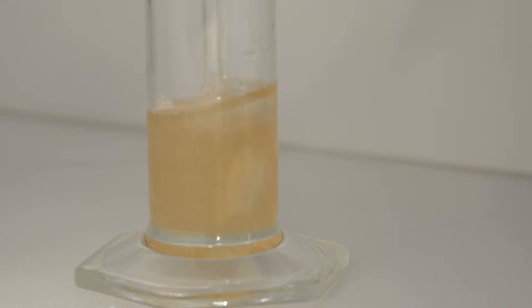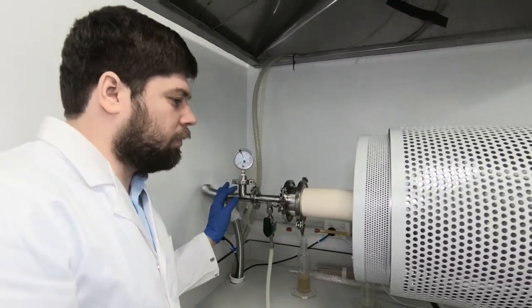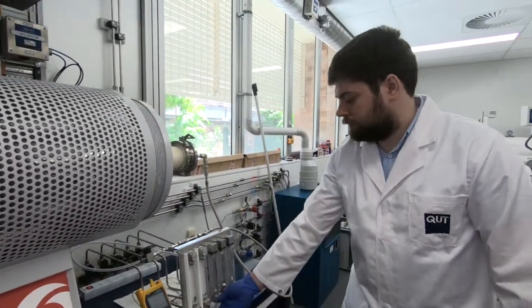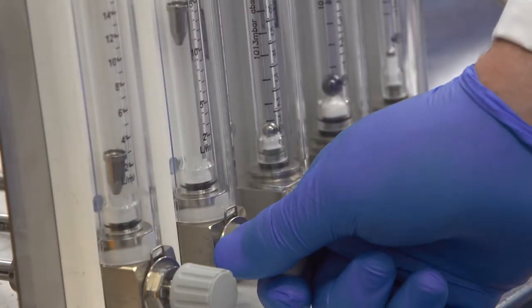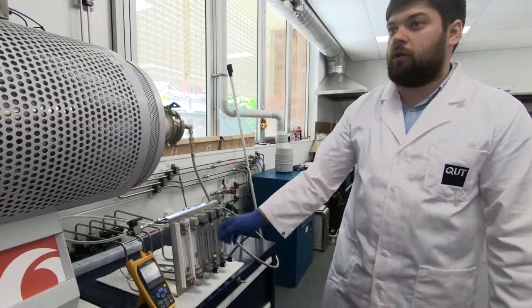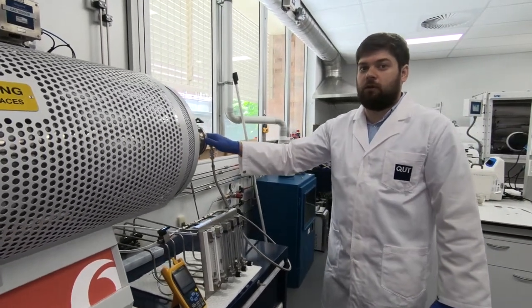Now we can open ammonia line. I set ammonia flow here. And now we have both gases going through our furnace.